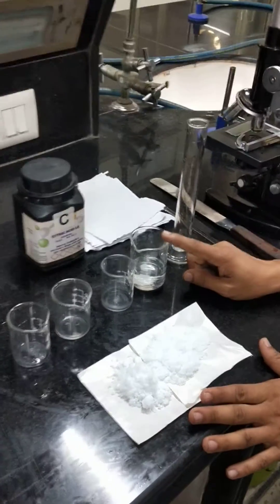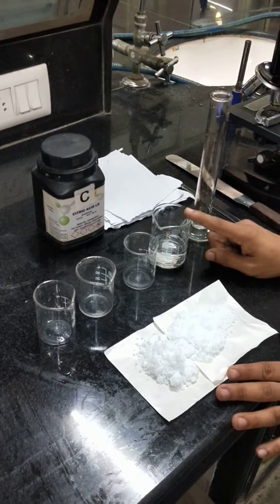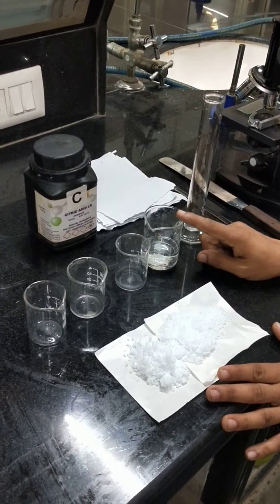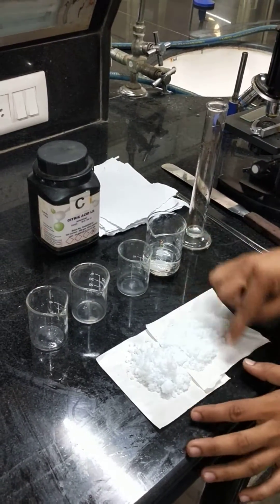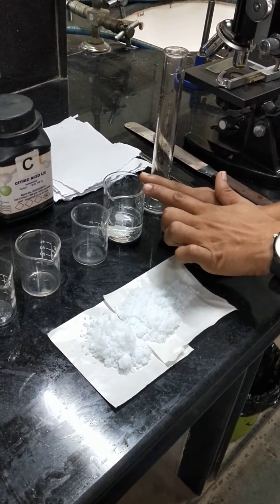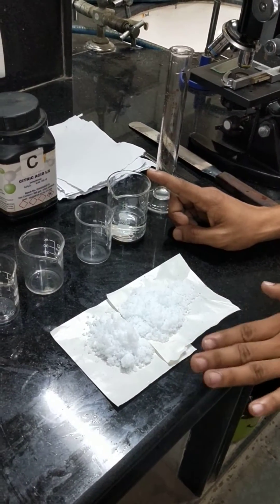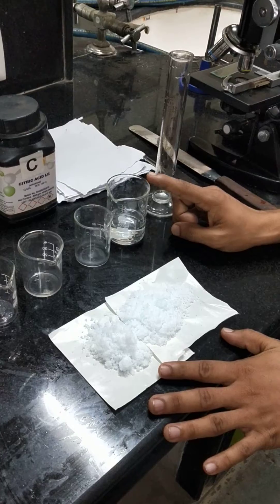We stir the solution until the citric acid is undissolved — at that point it becomes a saturated solution. The initial weight of citric acid is recorded as W1. The weight of undissolved powder is W2. The difference W1 minus W2 gives the amount dissolved.